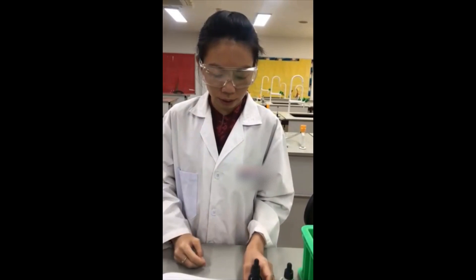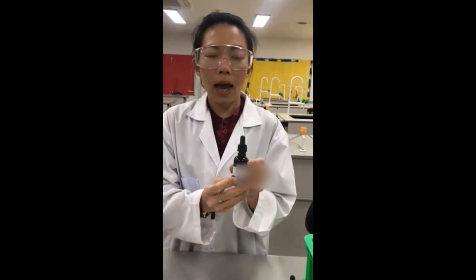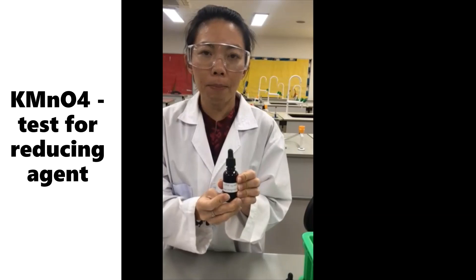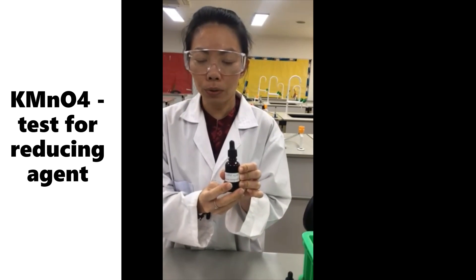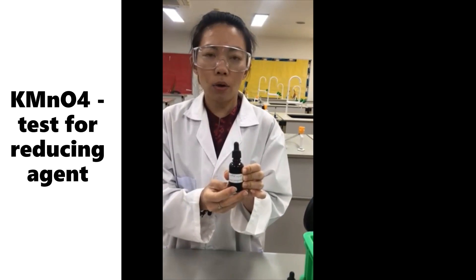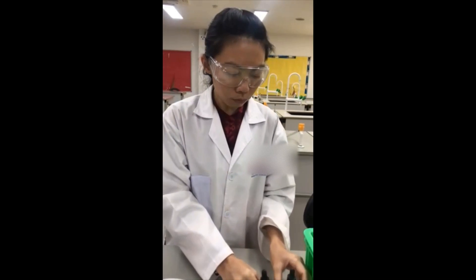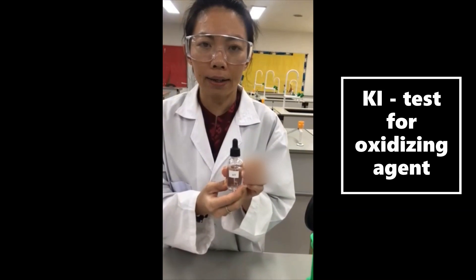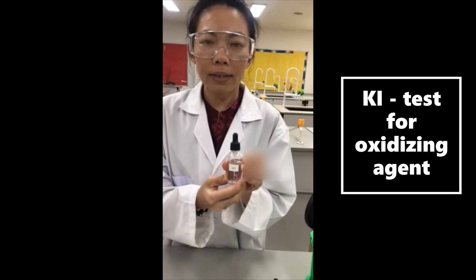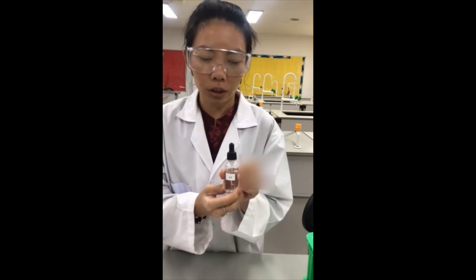There are two main reagents that we use for the experiment. The first one is acidified potassium manganate 7. This is the reagent you use to identify reducing agents. The second reagent is potassium iodide, which is used to identify oxidizing agents.